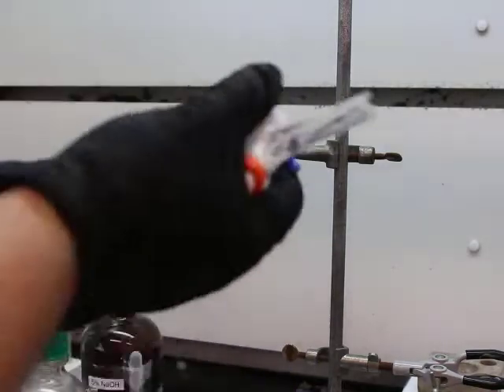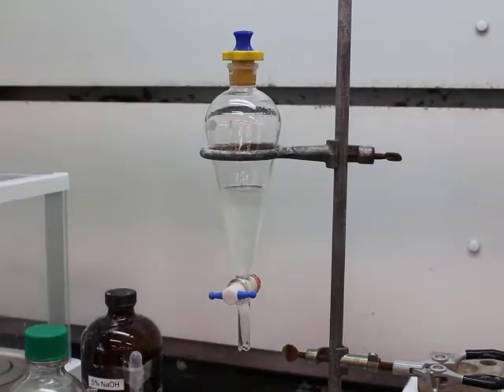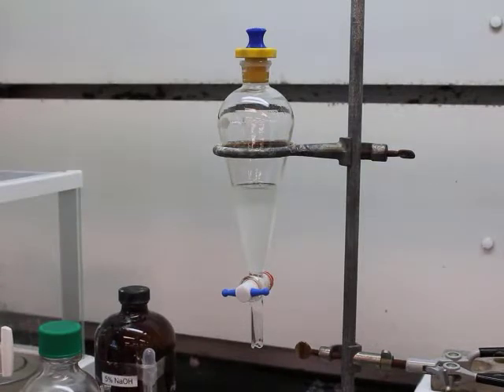So, in essence, if we have an acid in our unknown, it should react with the sodium hydroxide, and when it does, it will turn into an ion that will be highly soluble in the aqueous layer. And so big picture here is you have a solution of sodium hydroxide, and then you have a DCM layer, so your aqueous layer and your organic layer. So based off the density, you need to be able to determine which layer is which. Is the top layer your aqueous layer, or is the bottom layer your aqueous layer?